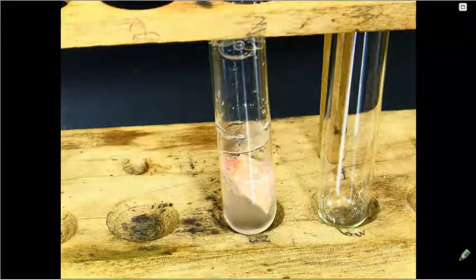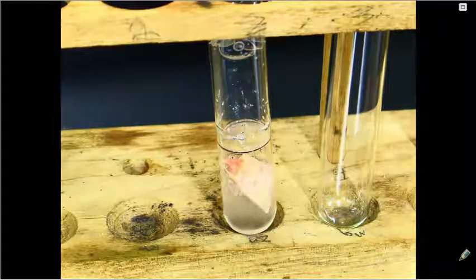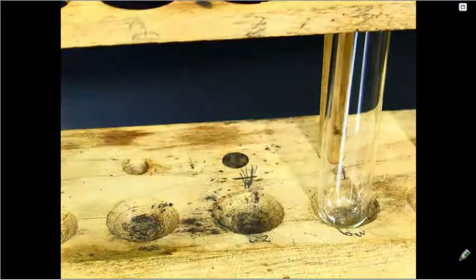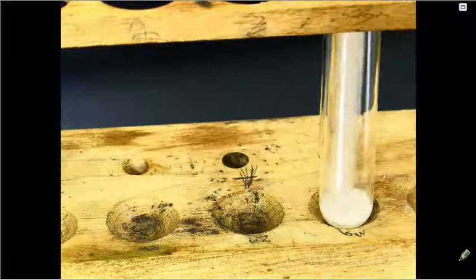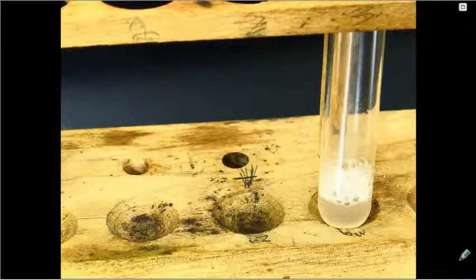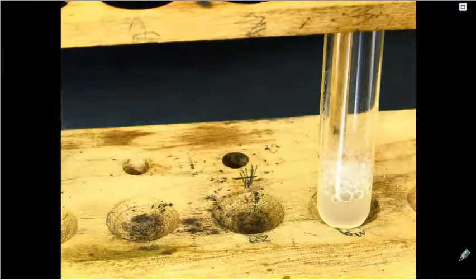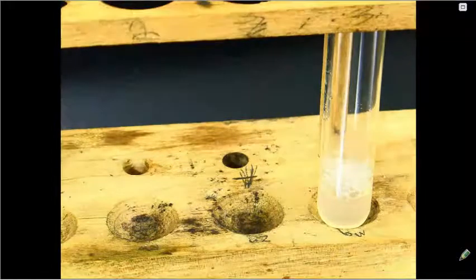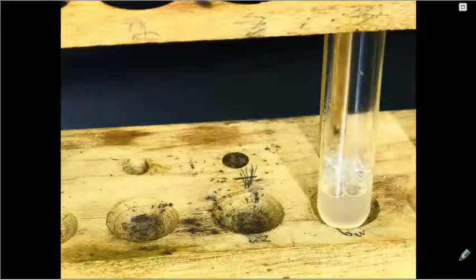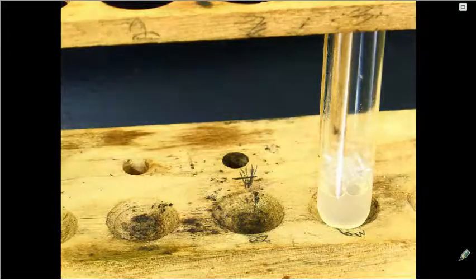Now I'm going to pour off that liquid solution from the first test tube directly into the second test tube. I'm keeping the liver still in the original test tube and setting that off to the side. So take another piece of liver, add it into my test tube.